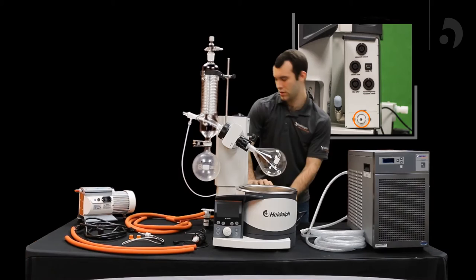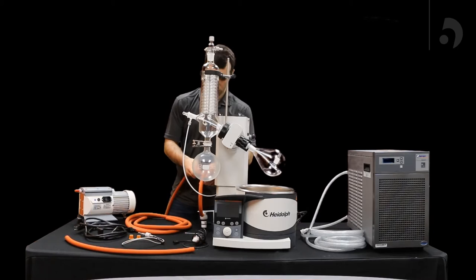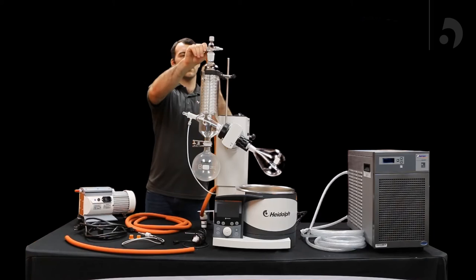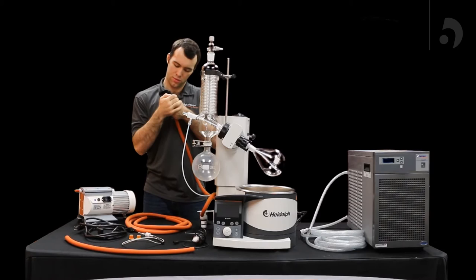Now with the other portion of the Y connector with your tube, you're going to pull off one of the connectors on your vacuum fitting and throw that into this tube and screw it back on.